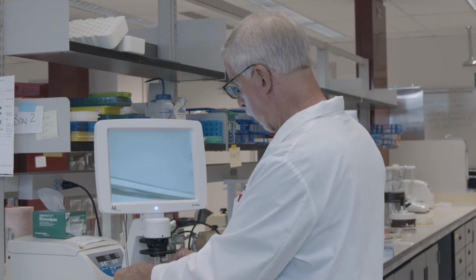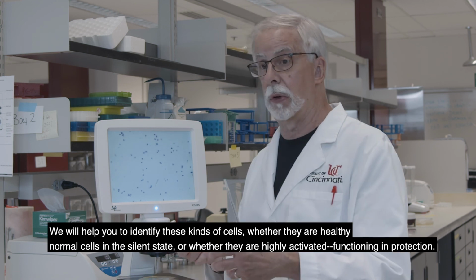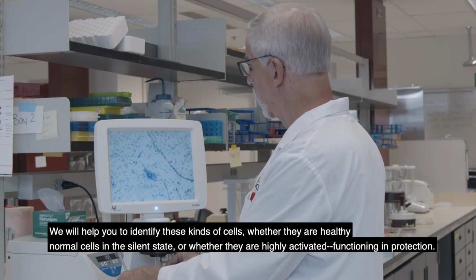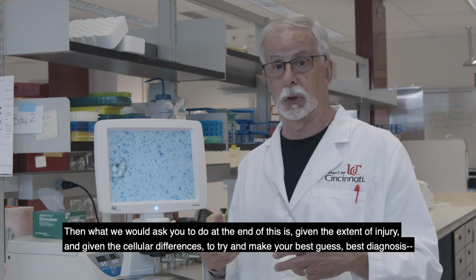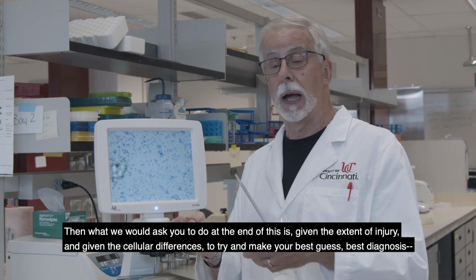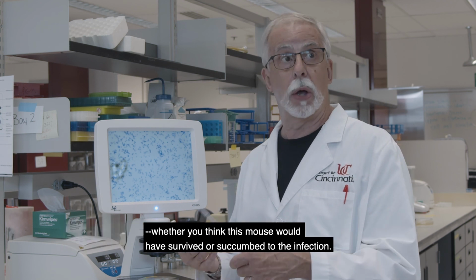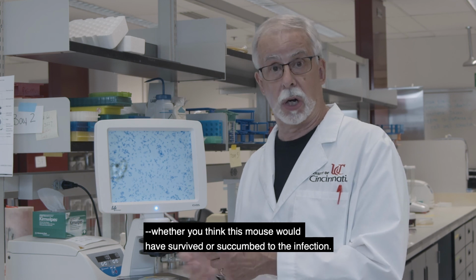So we will help you to identify these kinds of cells, whether they're healthy, normal cells in a silent state, or whether they're highly activated and functioning in protection. And then what we would ask you to do at the end of this is, given the extent of injury and given the cellular differences, to try and make your best guess, your best diagnosis of whether you think this mouse would have survived or succumbed to the infection.